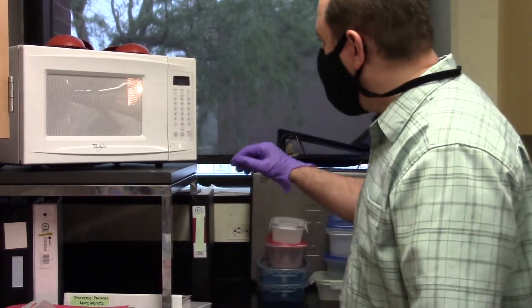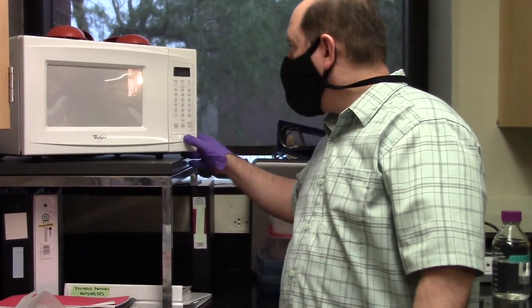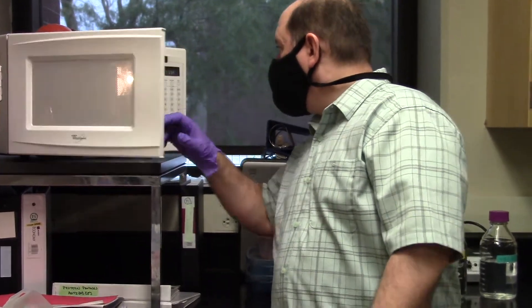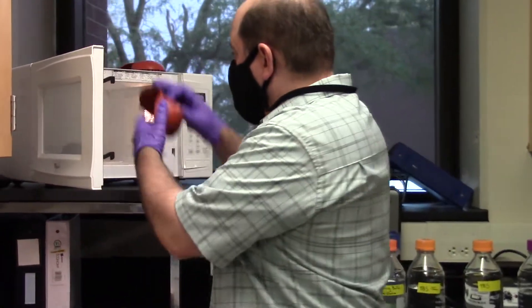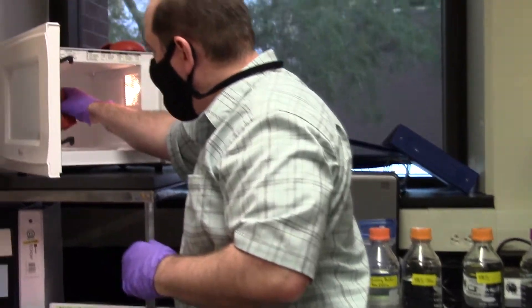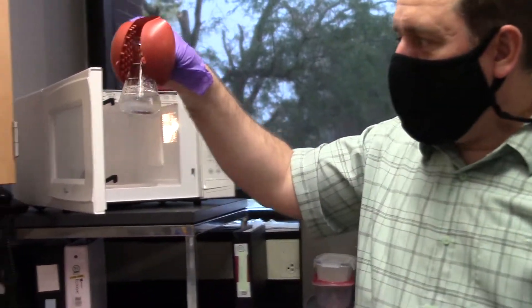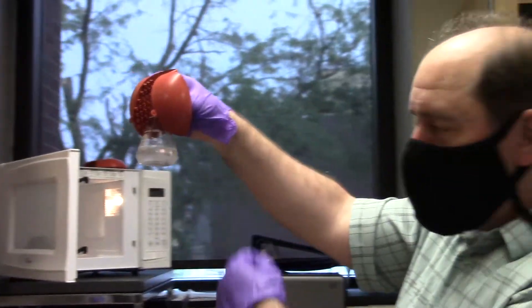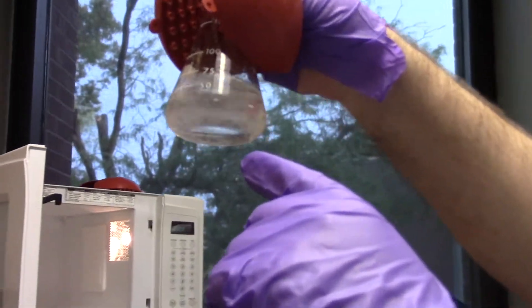When this is done in the microwave... and here it's going to come out. It has started boiling. I'm using what I like to call the grabber grabbers so that I can hold this. Can you see the air bubbles in there?